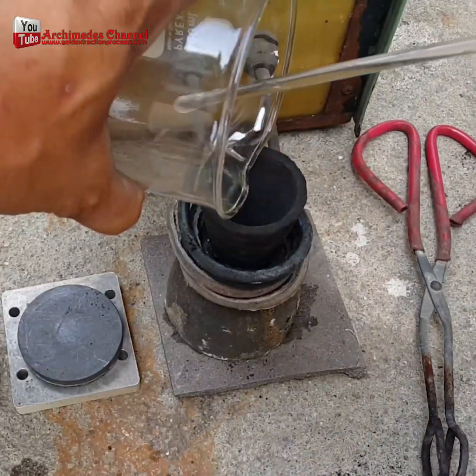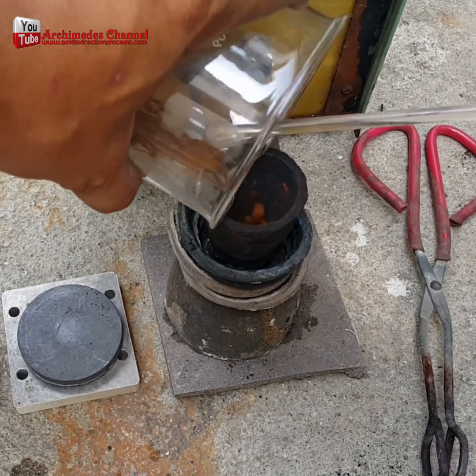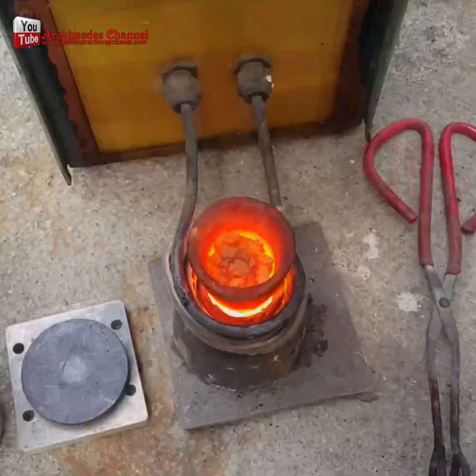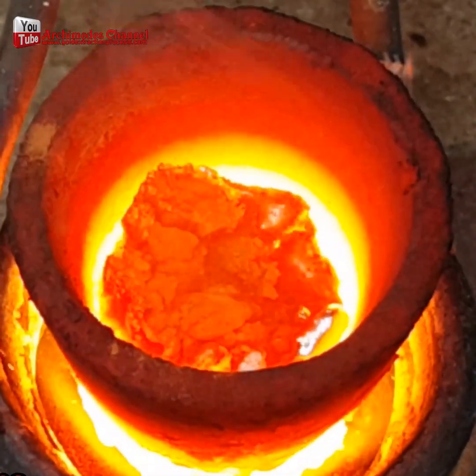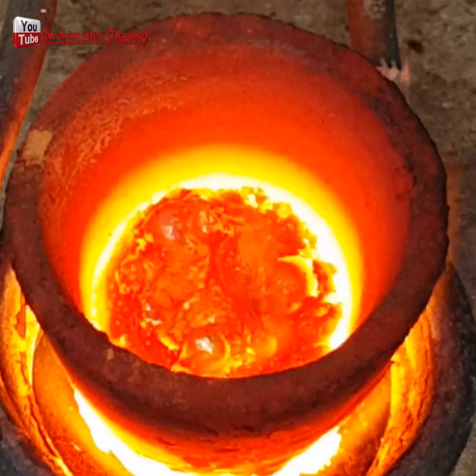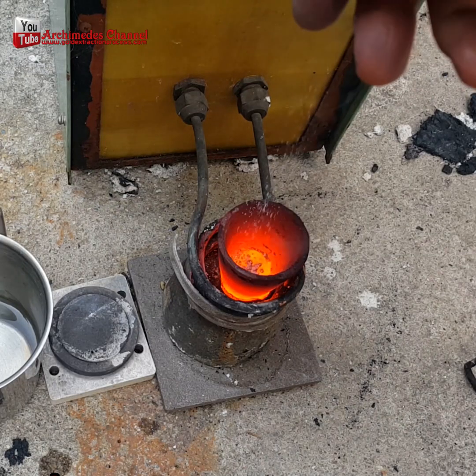Once you've got that, it's a matter of melting it down. That gold dust goes into a graphite crucible. An induction heater is used to bring it to the melting point, at which point the gold dust melts and becomes molten. Then once it's switched off, it'll cool to a nice golden nugget. A little borax is added to help the process along — just a pinch.